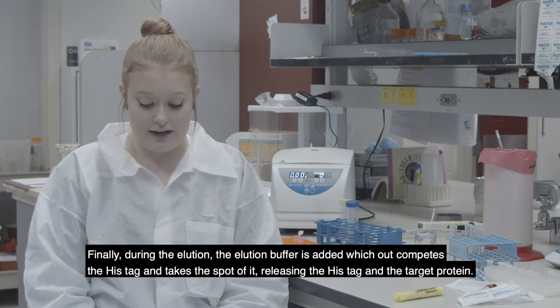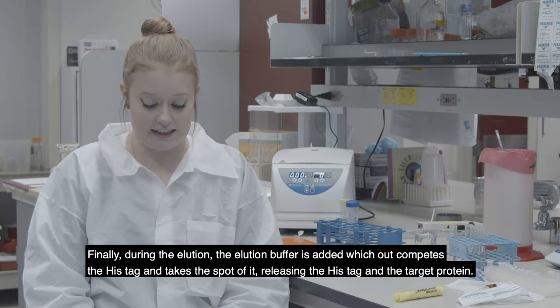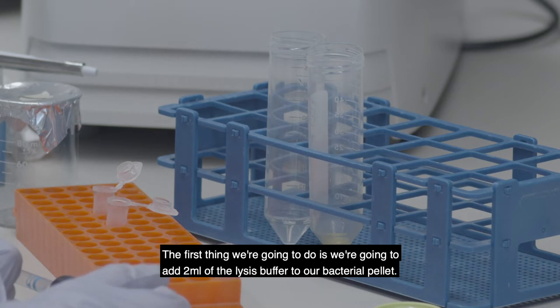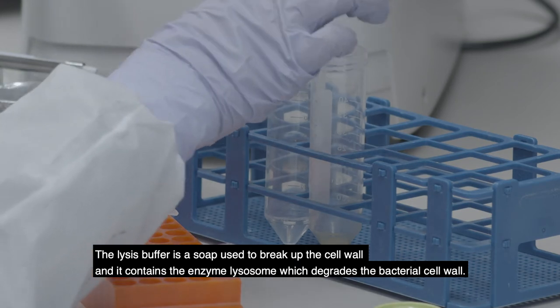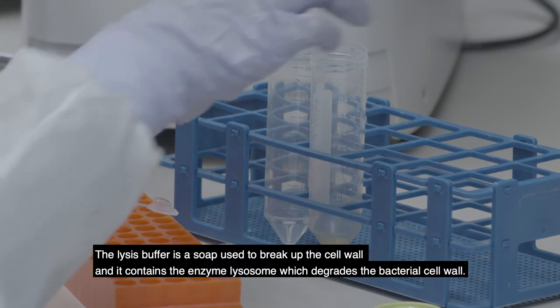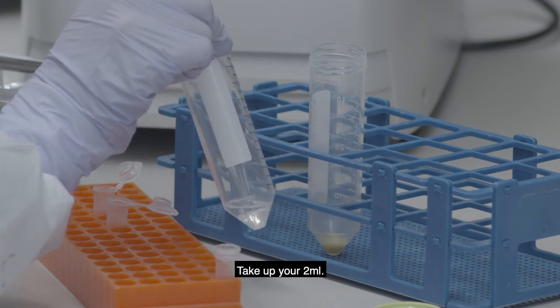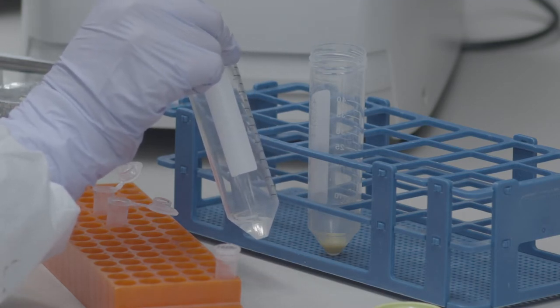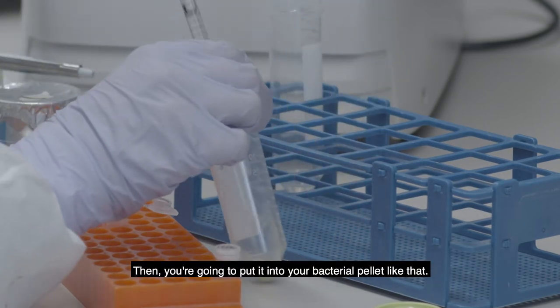Finally, during the elution, the elution buffer is added, which outcompetes the His-tag and takes its spot, releasing the His-tag and the target protein. So the first thing we're going to do is add 2 ml of the lysis buffer to our bacterial pellet. The lysis buffer is a soap used to break up the cell wall, and it contains the enzyme lysozyme, which degrades the bacterial cell wall. Just take up your 2 ml and put it into your bacterial pellet.